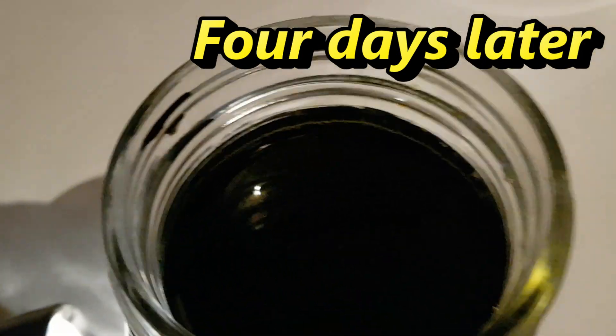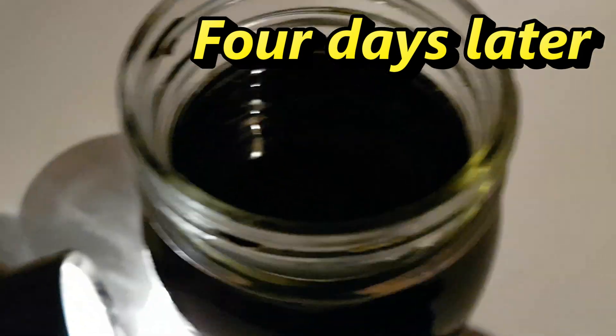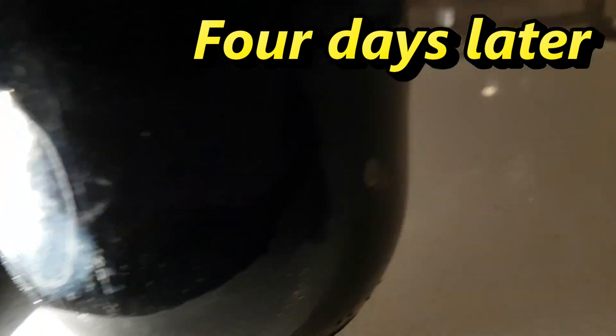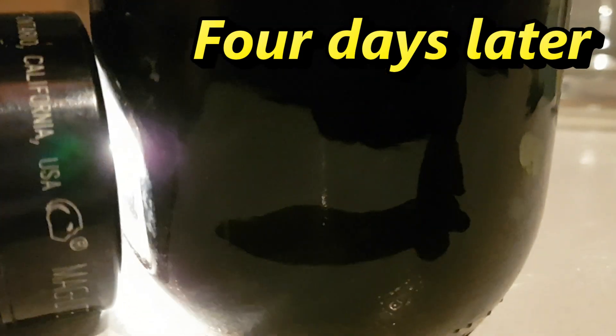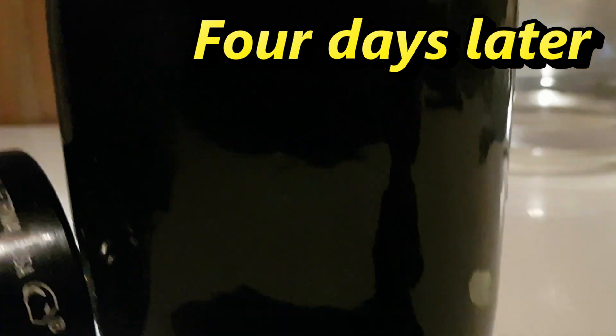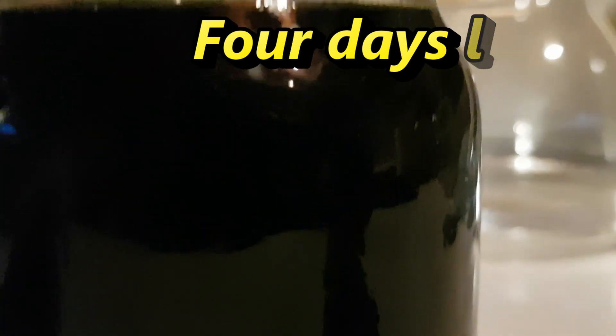Well, it looks like we're finally there. We've got no sign of bubbles so the reaction is pretty much finished. The acid of course is very very dark as it ate away all that metal. So it's time to take the next step in the process.